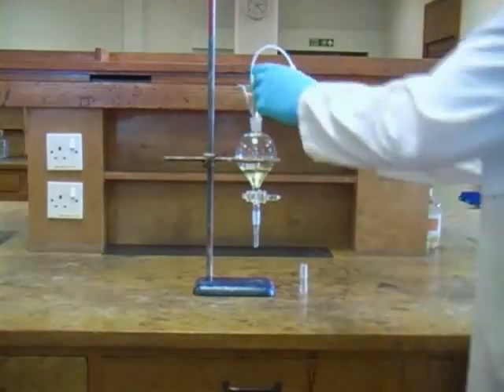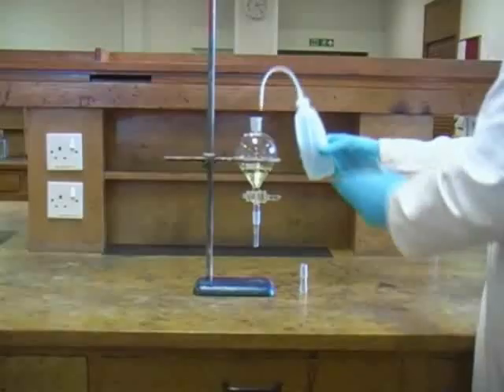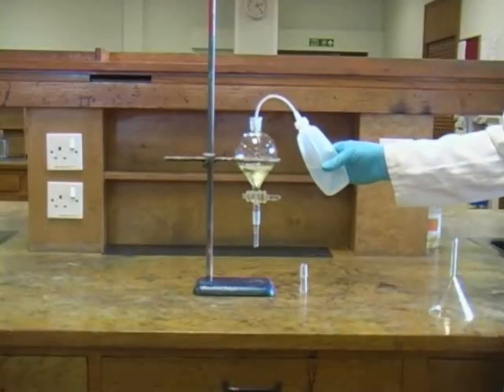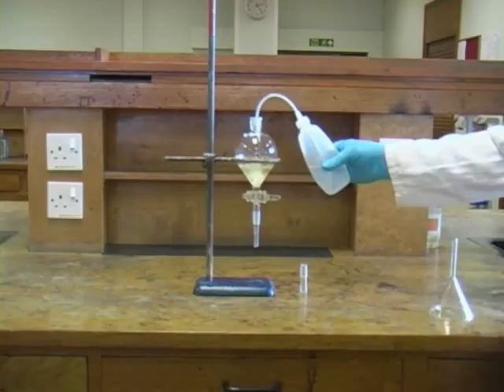Now we add the water which we're using to wash our reaction mixture with. It's important that you pay attention to your script which may specify a different solvent and a particular volume that you need to work with.